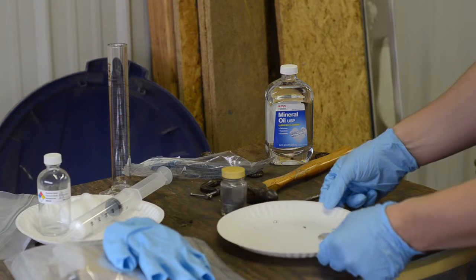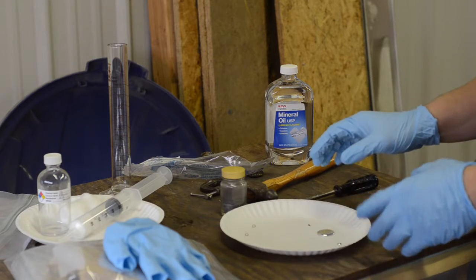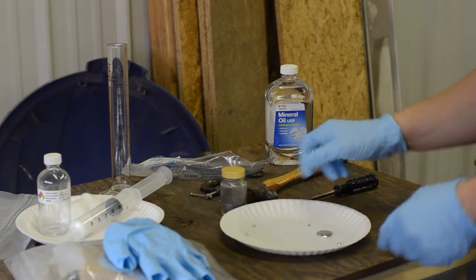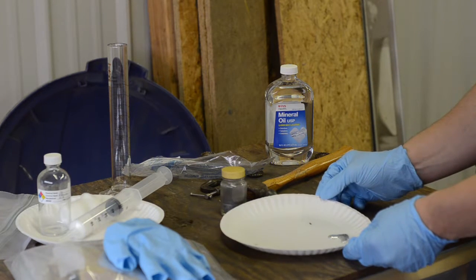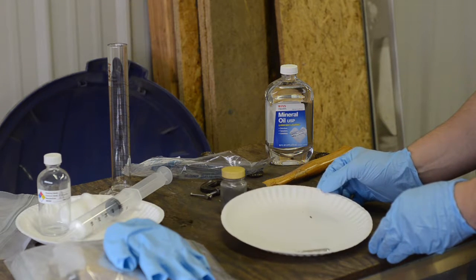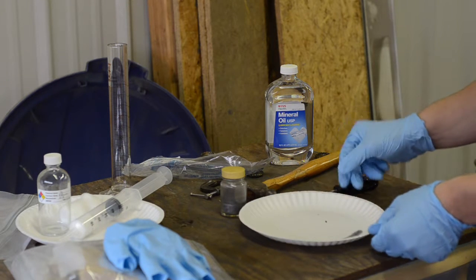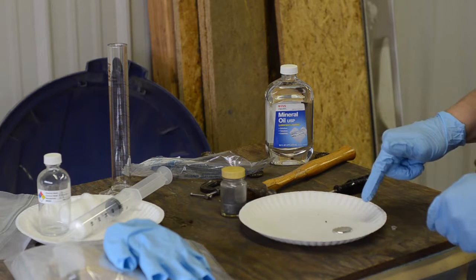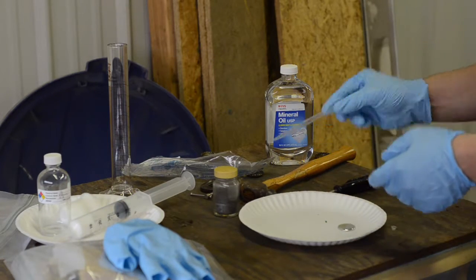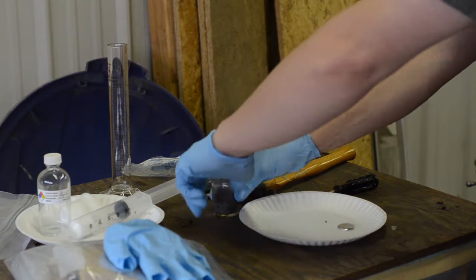Okay, so now that I've got the mercury out onto this plate, we have to be really careful with this because mercury, it runs. And I mean runs. Once it gets going, it's gone. So we're going to very carefully, and it does not take much, try to coagulate this mercury together. There we go. So now I've got all my mercury collected into one little puddle right here. And I'm going to go ahead and use a small plastic pipette to transfer the mercury into this original container.